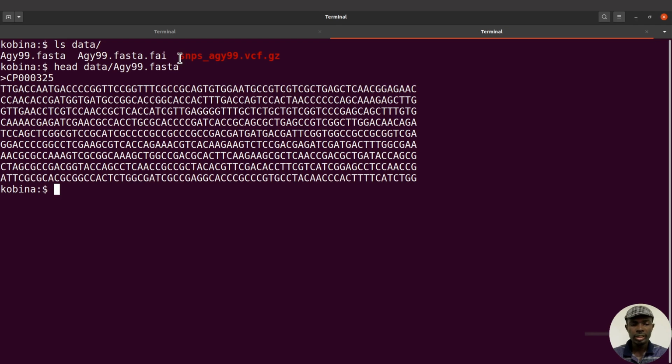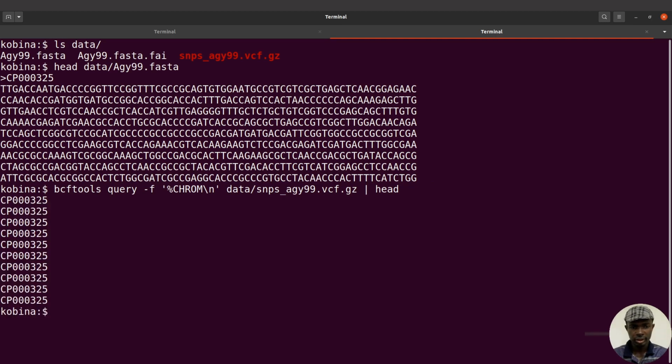So I will also list the chromosome name that has been indicated here for the variants. I'll use BCF tools, I'll say bcftools query -f, I bring a quote, I'll say percentage CHROM \n like this. And then I'll specify the VCF file, that's data/snps_agy99.vcf.gz. Now, because we have lots of variants, I just want to display just one of them. So I'll just say head. Okay, so I have that here.